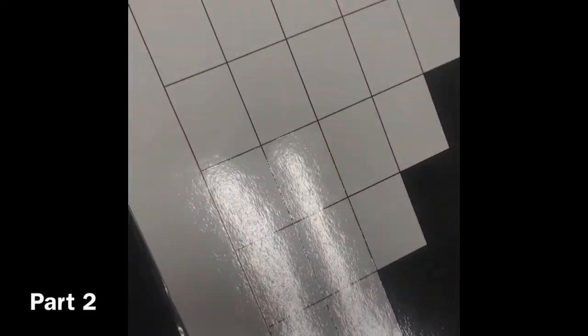Yeah, I don't know, man. What do we think? We have it. Hold the PB. Oh, here it is. Okay, PB3. Alright, this is what they look like. Looking good. Let's do this thing.